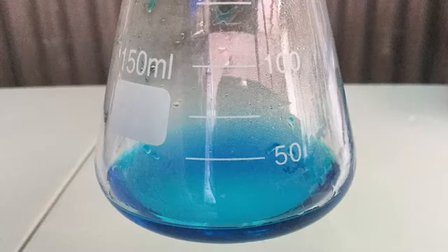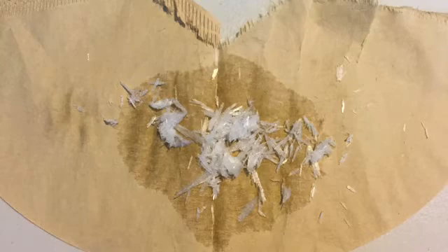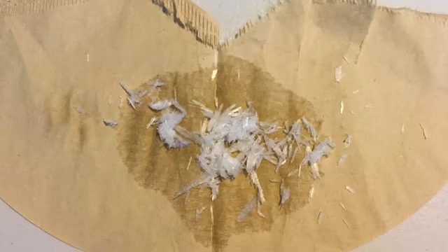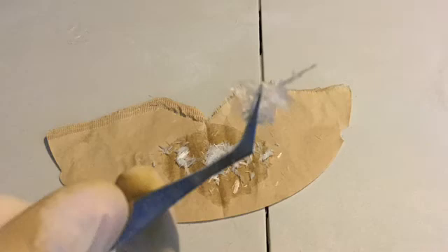Now back to the sodium hydroxide solution. This is what the sodium hydroxide looked like after it was taken out of the freezer, let to sit for a while, and then scraped from the beaker. Note, this is not the full amount of sodium hydroxide obtained — the yield was much higher than shown here. You can see that nice white crystals were obtained. The purity of the product is usually tested through some type of spectroscopy; however, I obviously don't have such equipment and had to assume the purity was higher than 98%. Here is a closer look at the crystals.